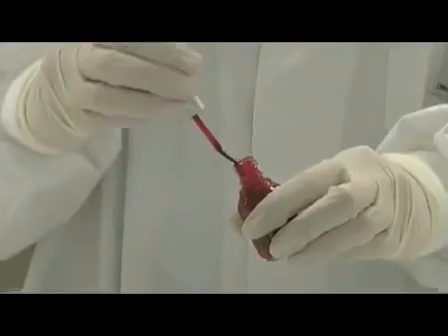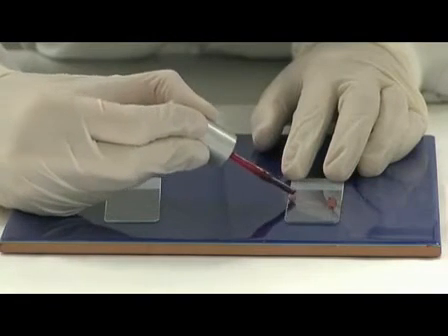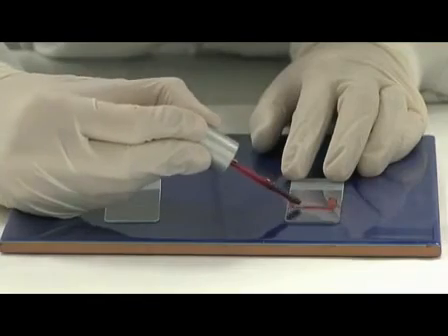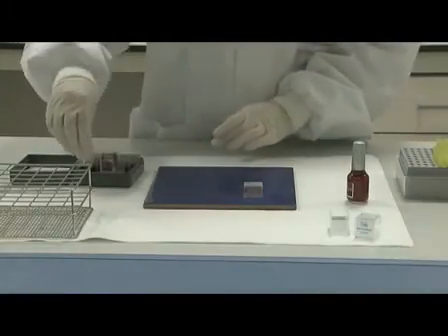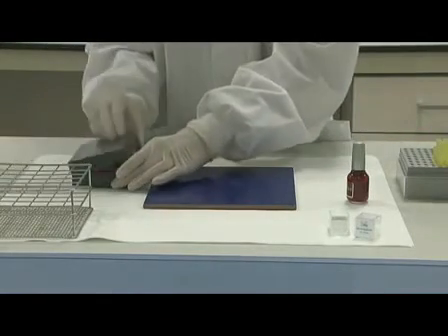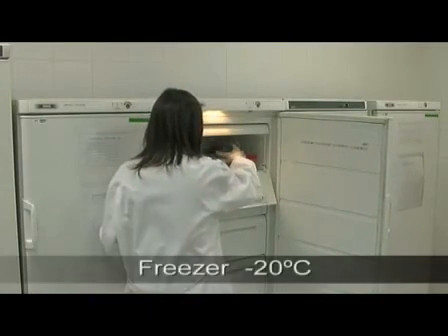The cover slide can be sealed with nail varnish. And now, the preparations are ready to be visualized. Otherwise, they can be stored at minus 20 degrees C until their prospective analysis.